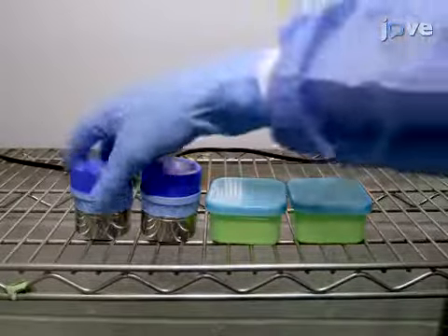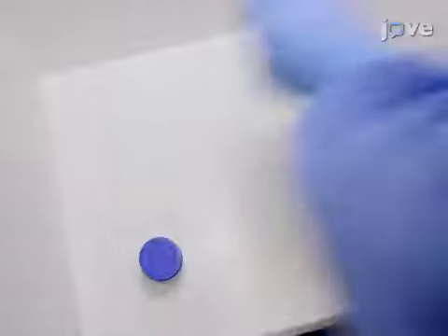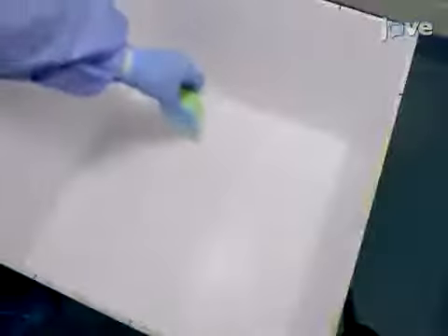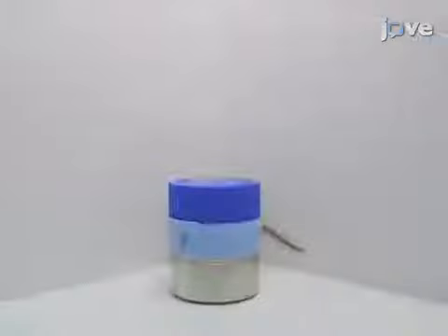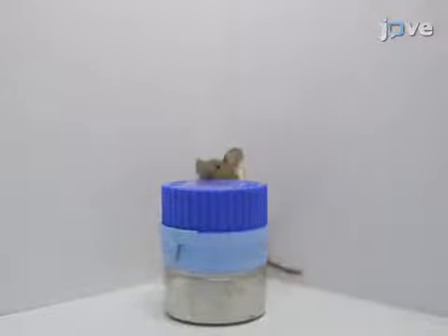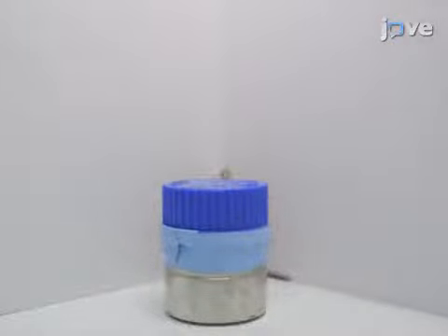Begin by selecting mouse-sized objects that can be easily discriminated by the animal but have a similar degree of complexity in features, such as texture, shape, or brightness, to minimize any potential induced object preference that may bias the results. Additionally, to further reduce induced preference, ensure that mice are able to climb on both objects or neither object, though ability to climb on an object may increase interest in exploration.